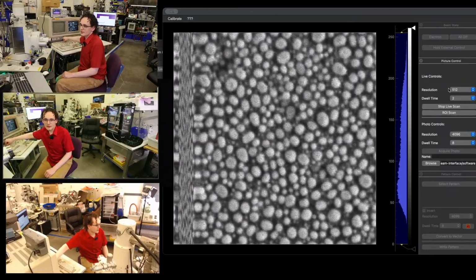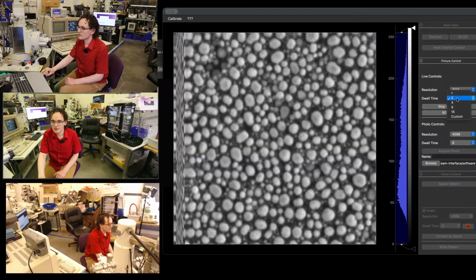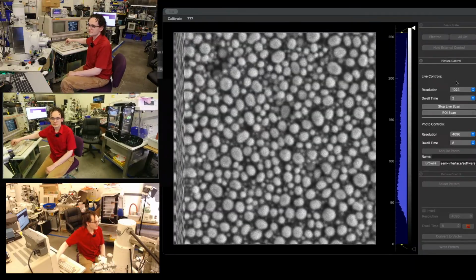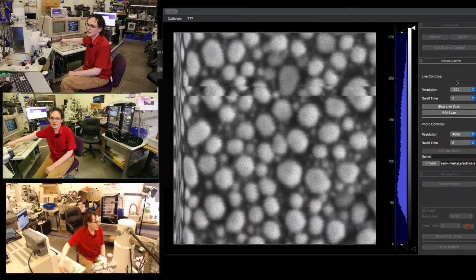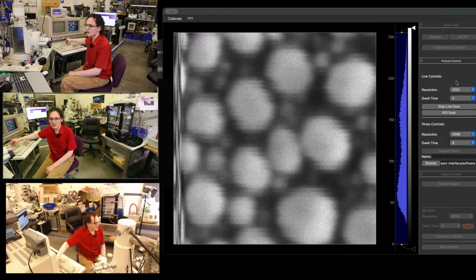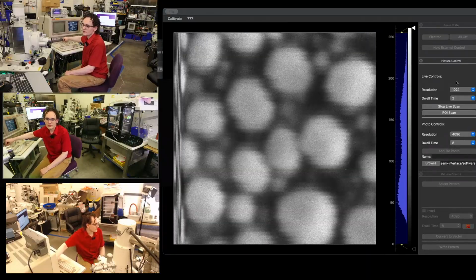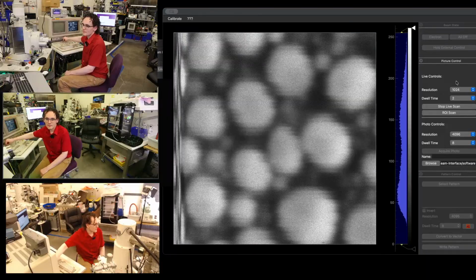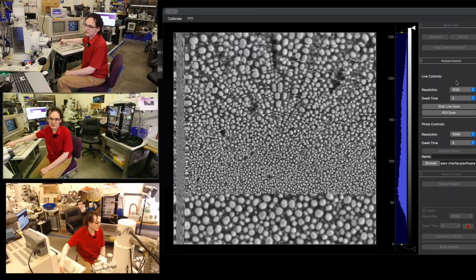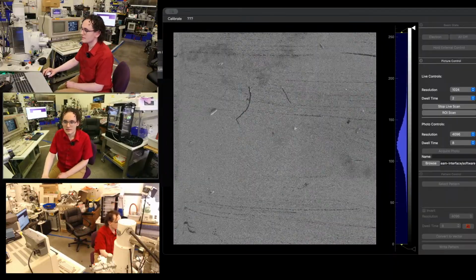The image is moving around a little bit right now because this whole thing's on springs and I bumped it. We'll go 1K scan, dwell time 2 is fine. So changing focus, okay, we got a little bit of wobble there. And now we are at this particular microscope's current noise floor. We suspect a scintillator power supply issue in this platform that is leaking 60 hertz in through the 10 kV and causing the beam to deflect. But we're doing EDS tonight, so we don't need to zoom in very far. We're zoomed in at 40,000 right now. What we're really going to be using is that really high spot size. So yeah, that is our install.